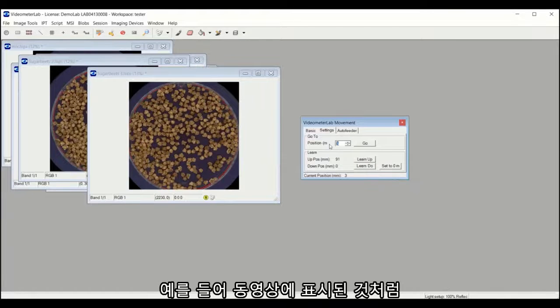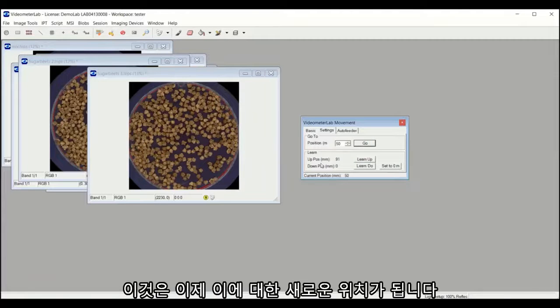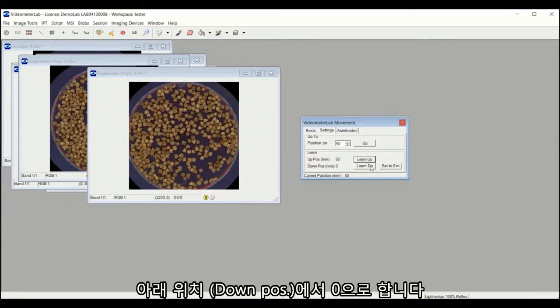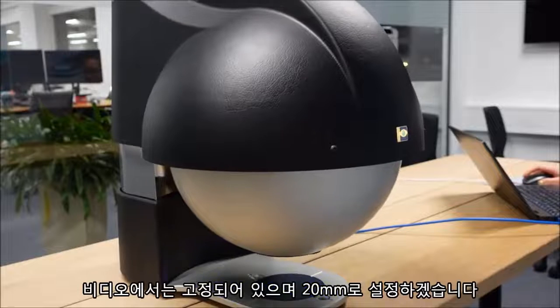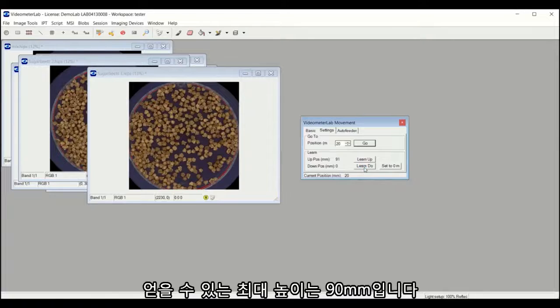For example, as shown in the video, the device is moved to a position of 50 mm, and when pressing Learn Up, this now becomes the new up position for the dome when taking images. In the same way, the down position can be set to something else than 0 mm. In the video, it is for example set to 20 mm. The maximum height that can be obtained is 90 mm.